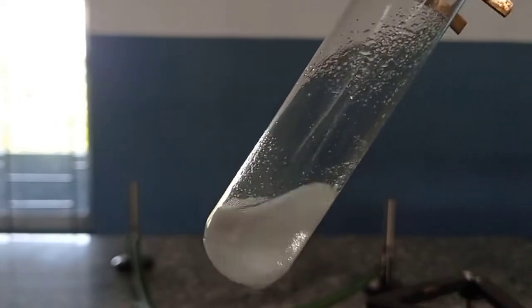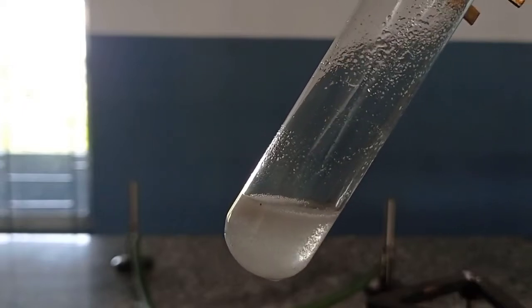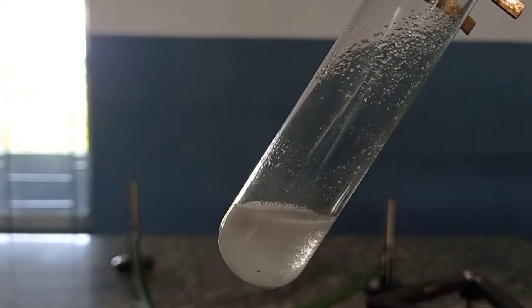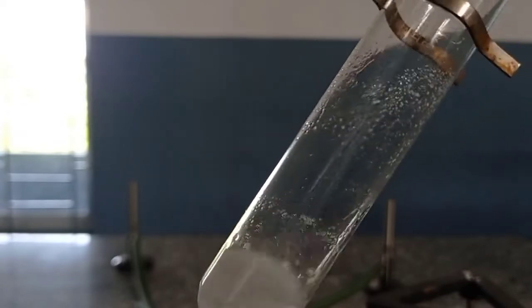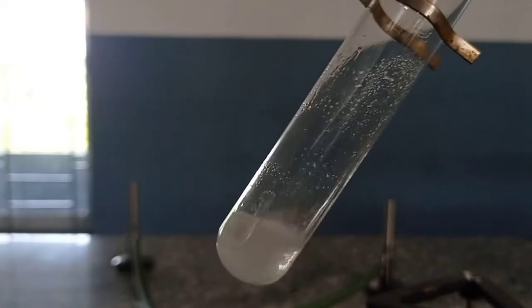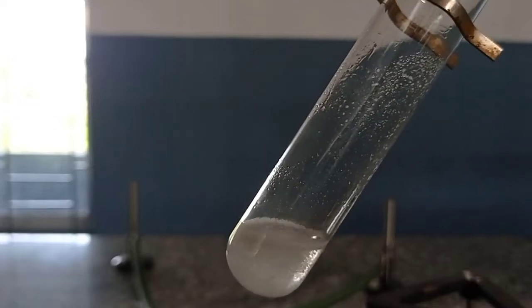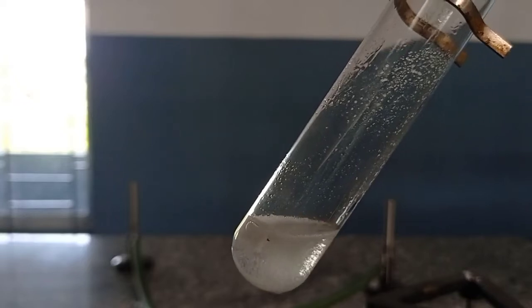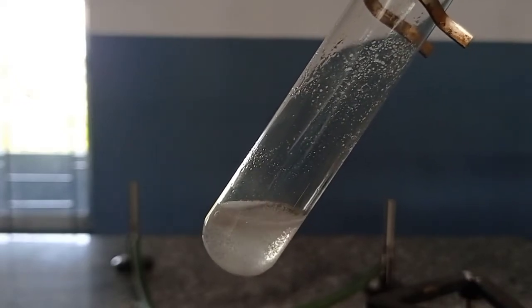Carbon dioxide gas in this demonstration is liberated in the form of effervescence. Effervescence is a term we usually use to describe whenever there is some gaseous formation in the form of bubbling in the liquid or solution during the course of a chemical reaction.